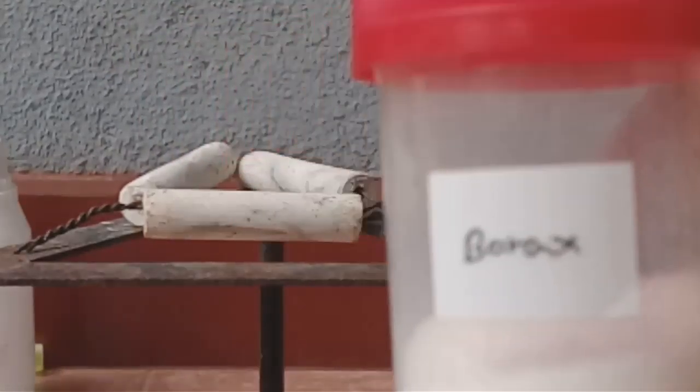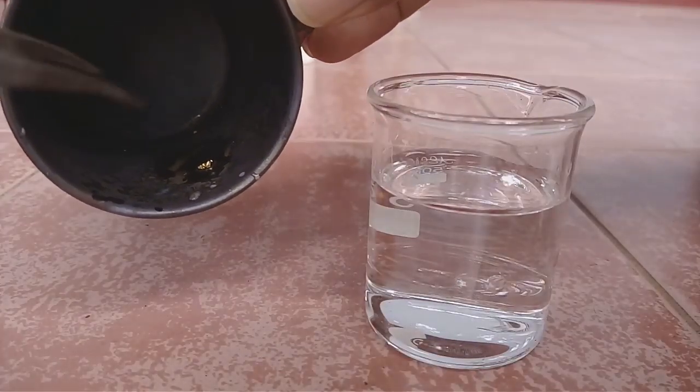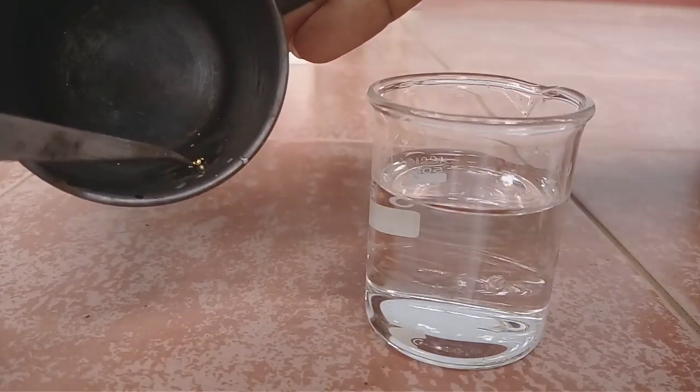Now I am going to add this gold to water. Now you can see here there is the gold.